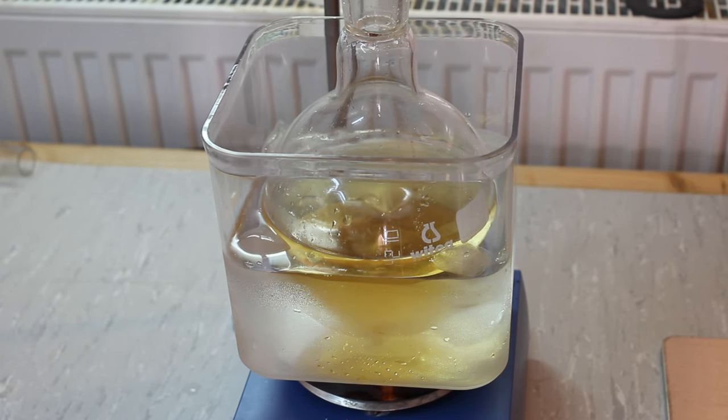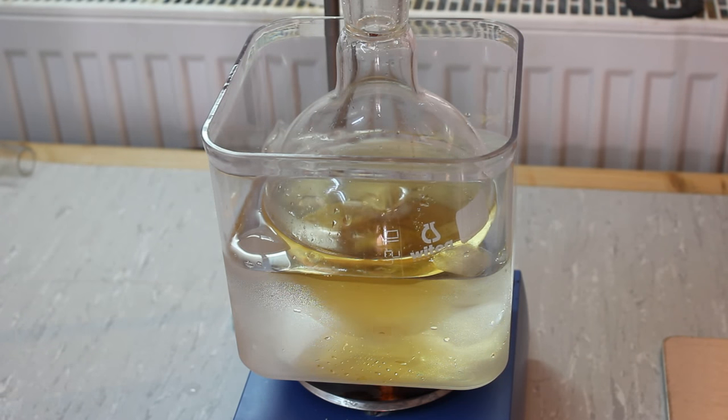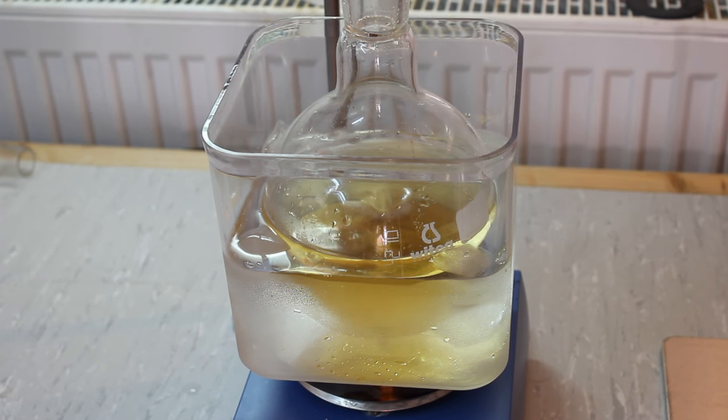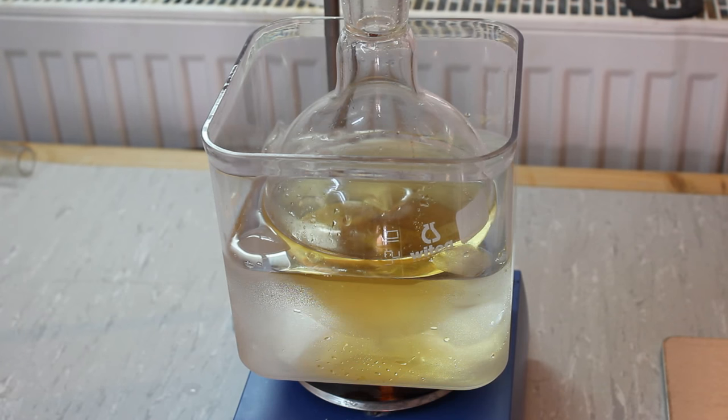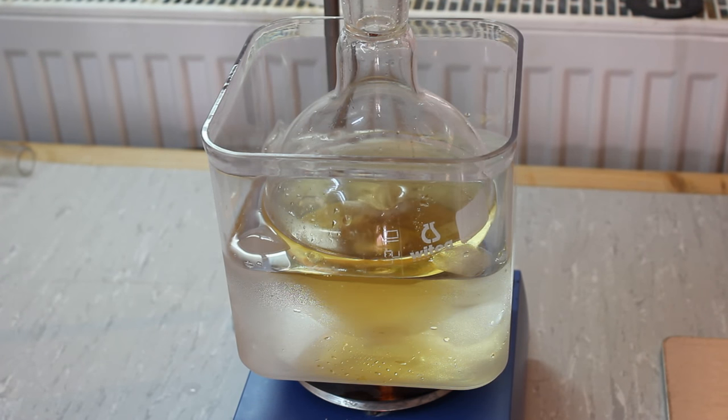All of the hydrobromic acid has been added so I'm going to switch out our cooling bath for a heating bath and set up for fractional distillation of our product.